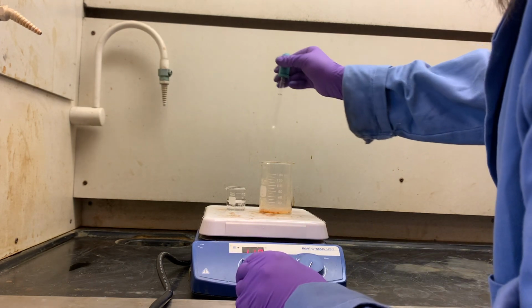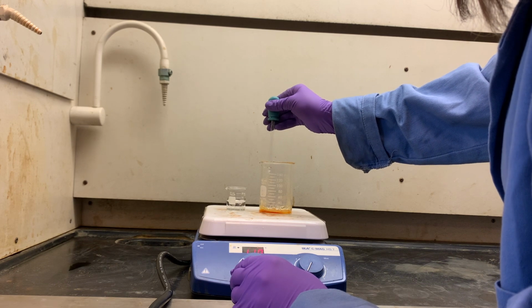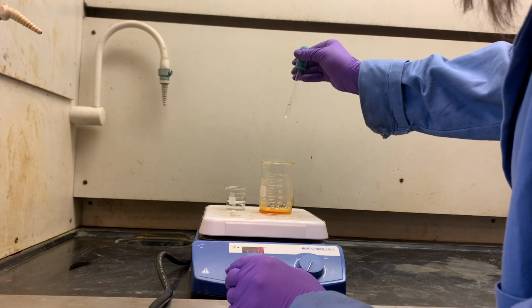Take the melting point along with the melting point of your crude and pure products from earlier. Finally, take H-NMR spectra of the two pure products. Congratulations, you've prepared your amine.